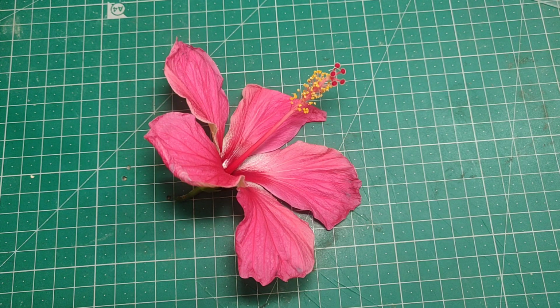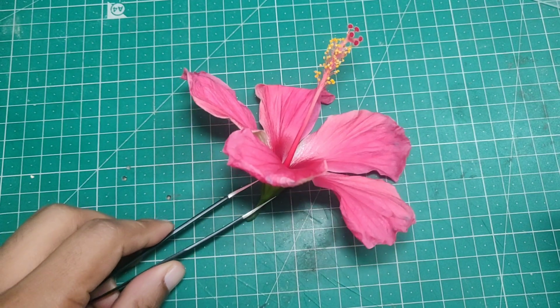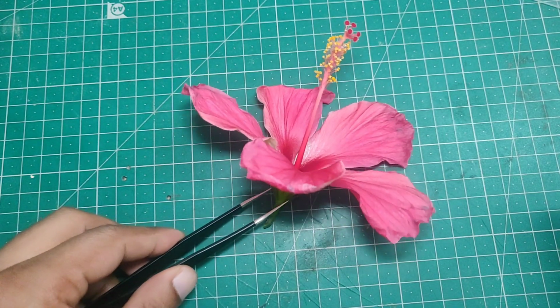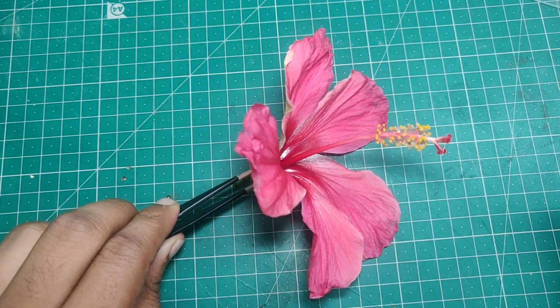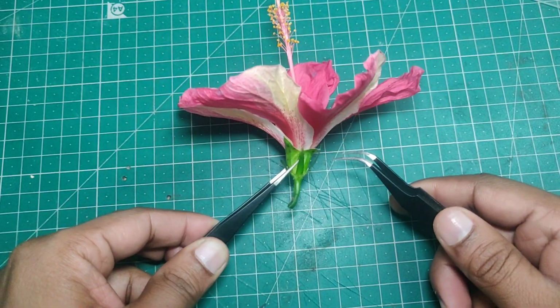In today's video, we are going to explore the hibiscus flower and all its parts, not just with the eyes but under the microscope at 50x magnification. Everything you will see today is real. No animation, no editing tricks. If you're watching on a mobile phone, I recommend watching in full screen. Let's slow down and observe.